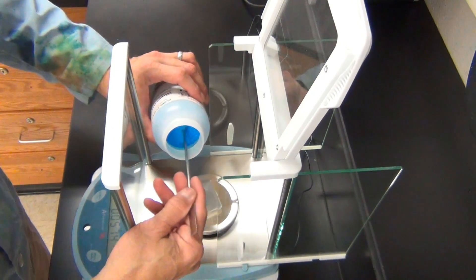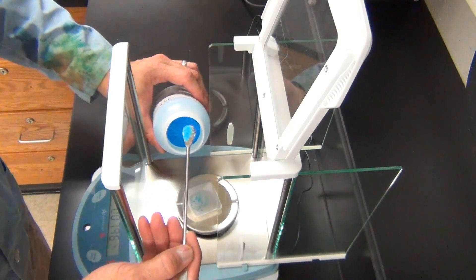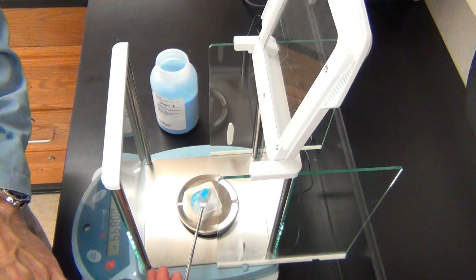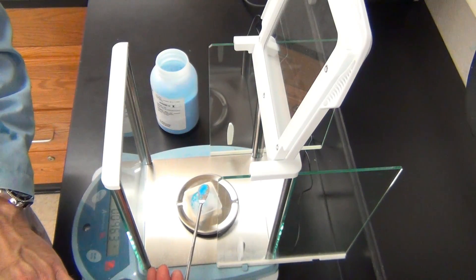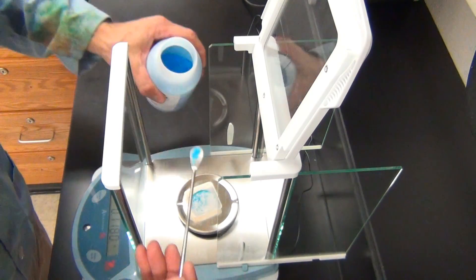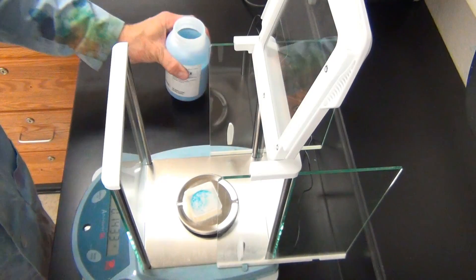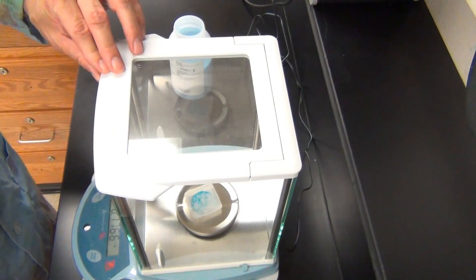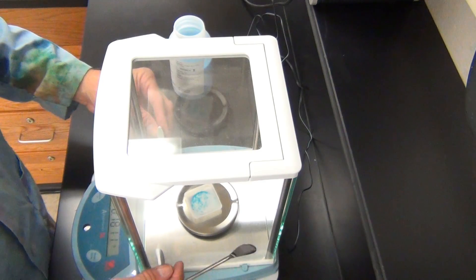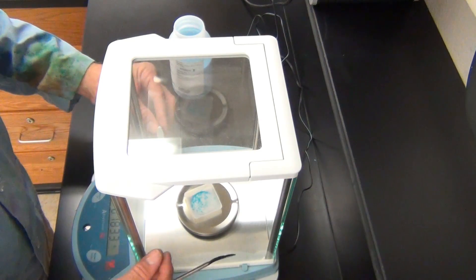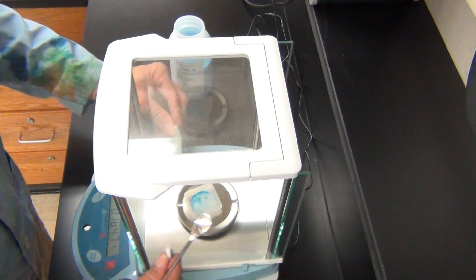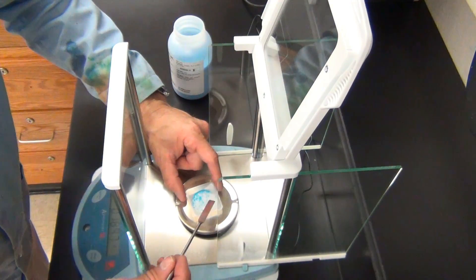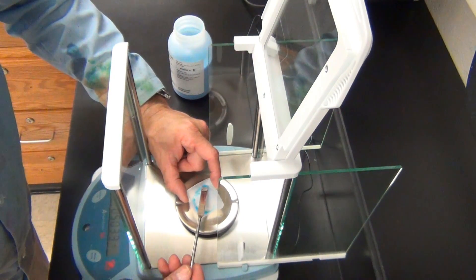I'm still light, and now this is not a fast procedure. This does take time. You have to take your time. And now, I have overshot by quite a bit, so now I have to take some off. And so now, to do this, this is where the flat end of the spatula. I'm going to lift the boat up, and try to get some of the chemical on this spatula. But the whole time, I'm keeping the spatula over the balance, so that no chemicals get anywhere else, but in the container where they belong, or on the weighing boat.